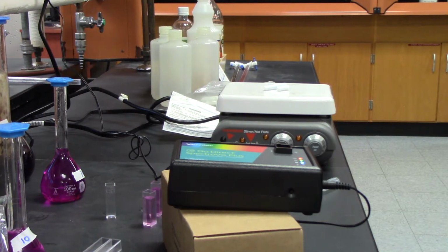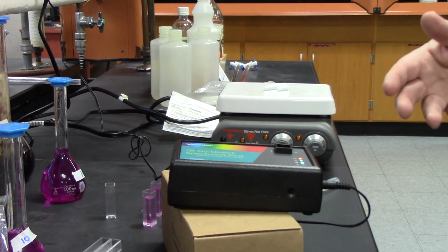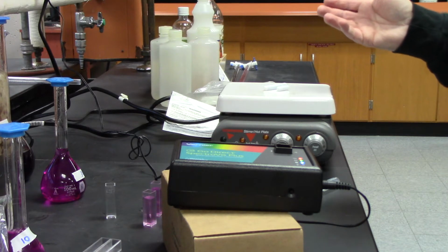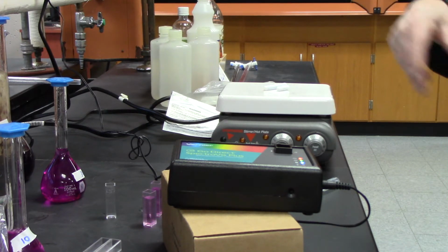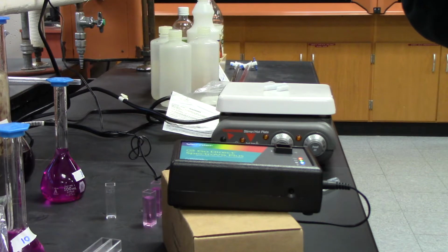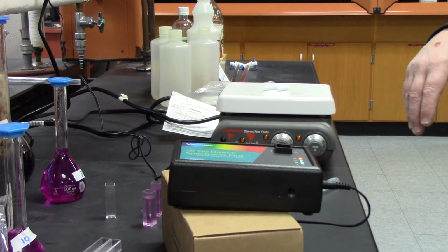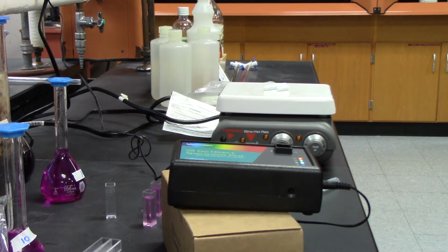There should be a direct relationship between concentration and absorbance. So we have three samples at 10 to the minus fifth, 20, and then 30. And then what we hope to see is that 10 may give you a value, maybe like 0.2, and then 20 you would hope to give you around 0.4. And from that we can come up with a line and see what the relationship is between the two and get a slope. And then we could use the unknown, which will be the last part of this experiment.